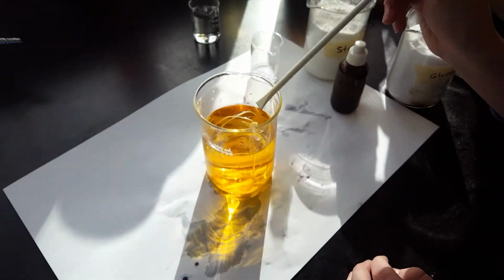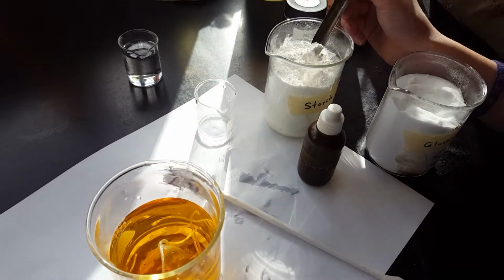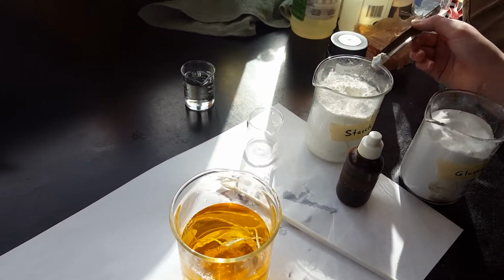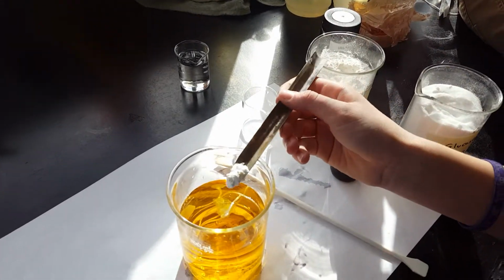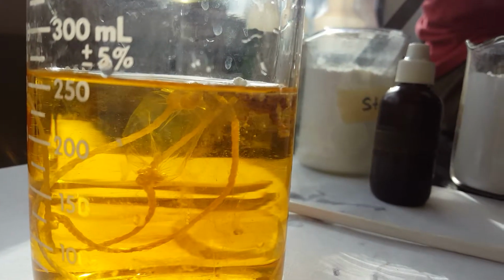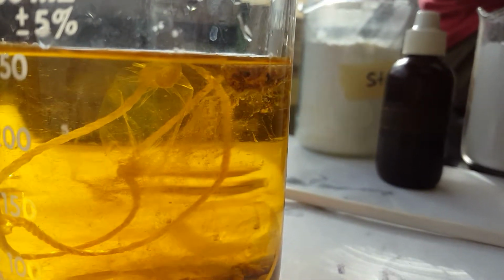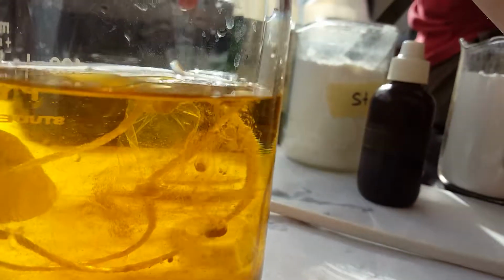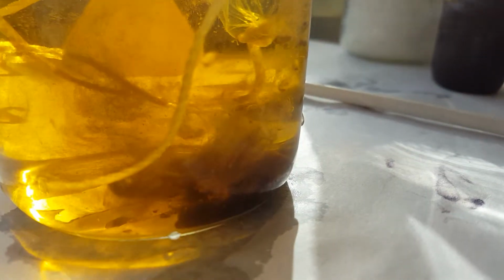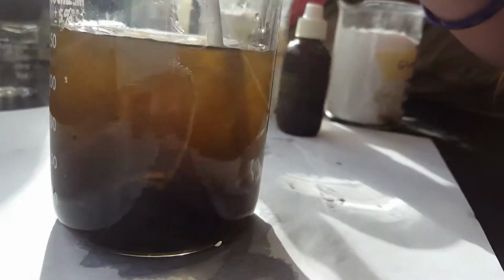Good. And then our next step is we're going to add a little bit of starch to the solution. A little bit less than that. When you add starch, watch what happens to the solution as the starch goes into the solution. Iodine is an indicator for starch. So iodine helps you see starch if you don't know that starch is already there. And what you should be noticing is the color change as this iodine and the starch interact. Okay, give it a little bit of stir. And especially when we stir it, you'll notice the color has definitely changed.